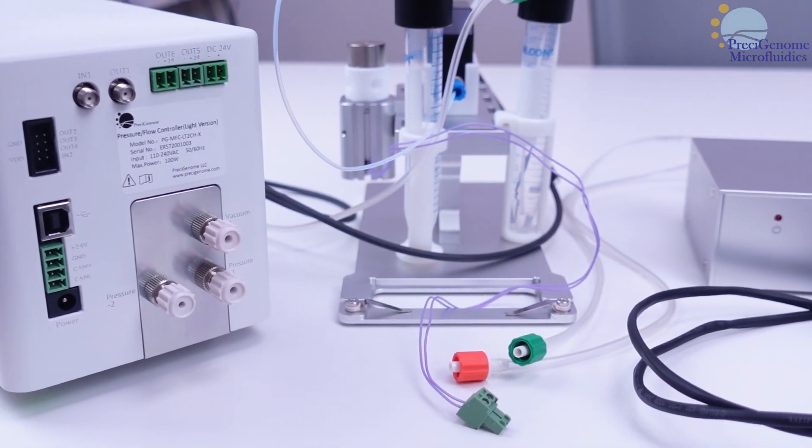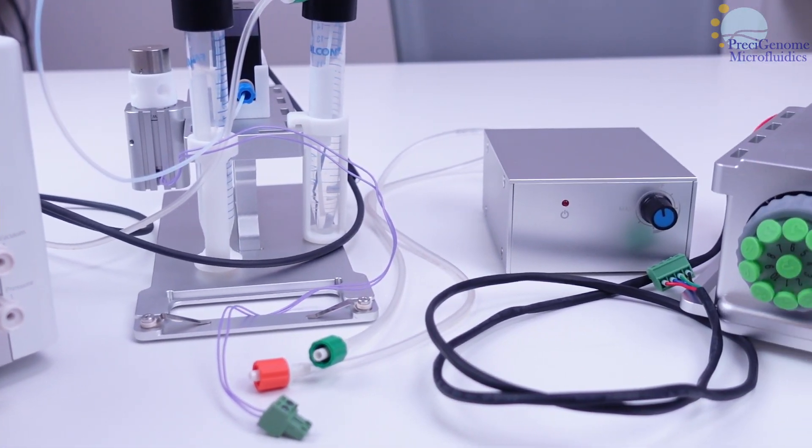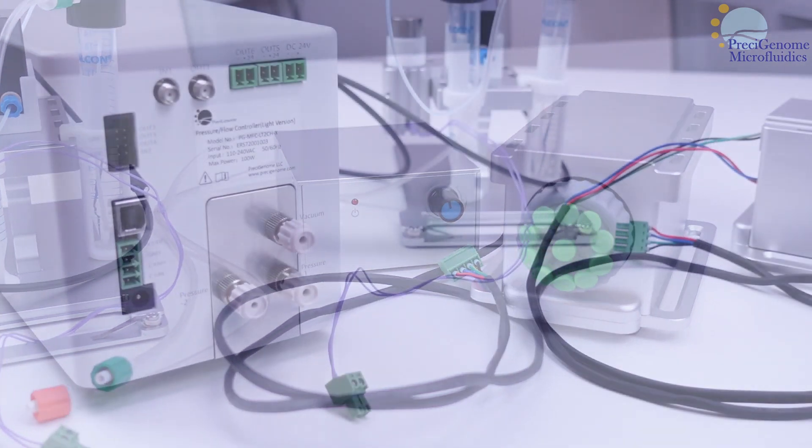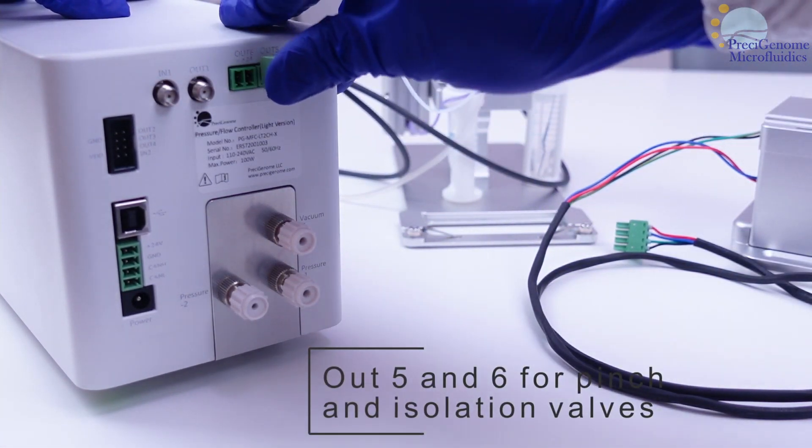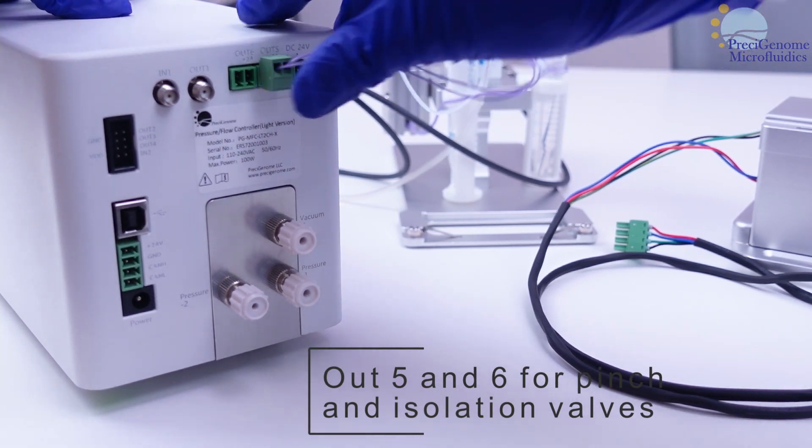We'll now go over the rear I.O. of the controller. Pinch and isolation valves may be plugged into outlets 5 or 6, but not the DC 24V one.